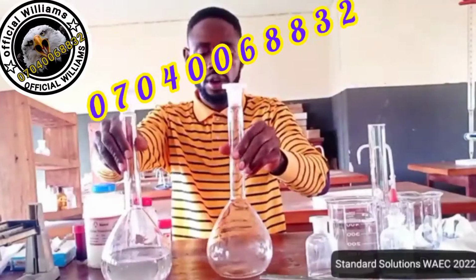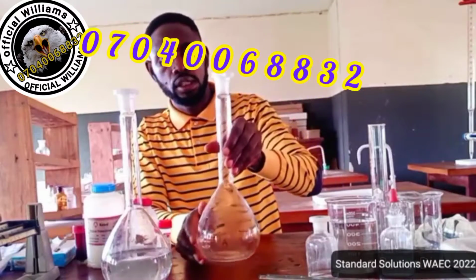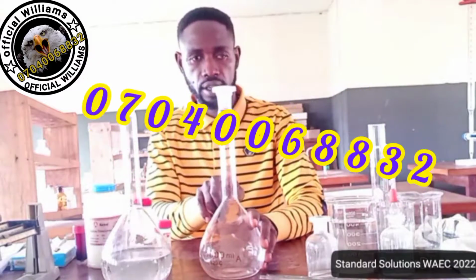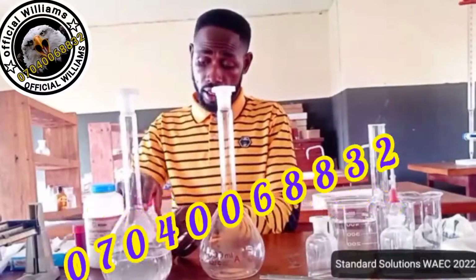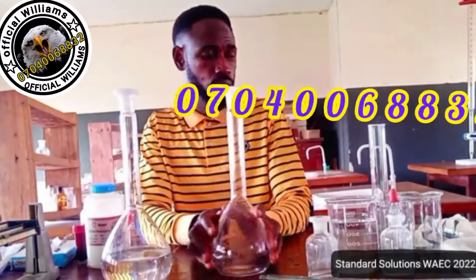First, what are the materials we need? We need 2 volumetric flasks. The 2 volumetric flasks are here. The 1000 ml, that is for accurate volume measurement. You see the mark, the ring here is for 1000, then here also for 1000. Then I filled one with water. I'm supposed to fill this one also.